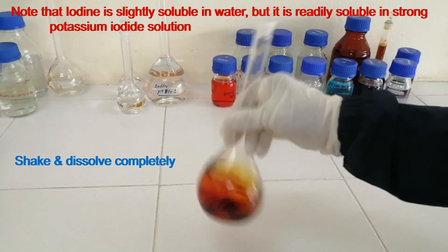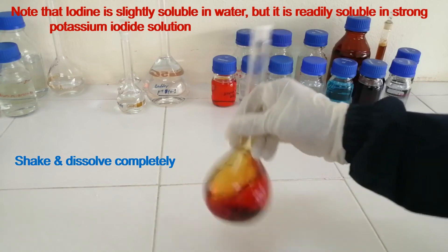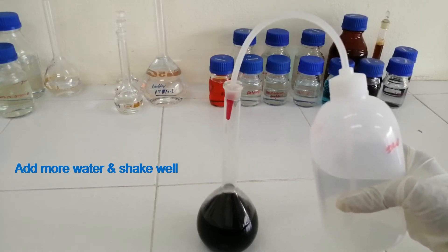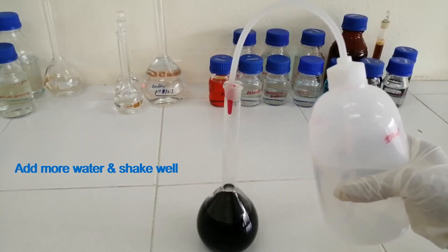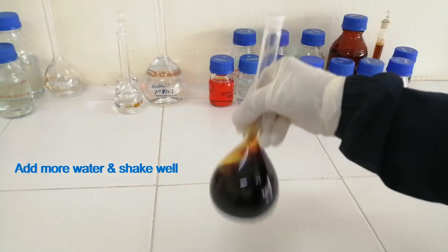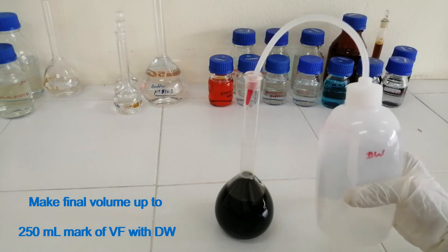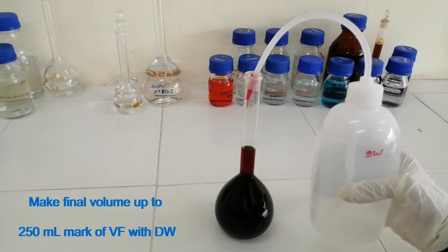Note that iodine is slightly soluble in water, but it is readily soluble in a strong potassium iodide solution. Add more water and shake well. Make the final volume up to the 250 ml mark of the volumetric flask with distilled water.